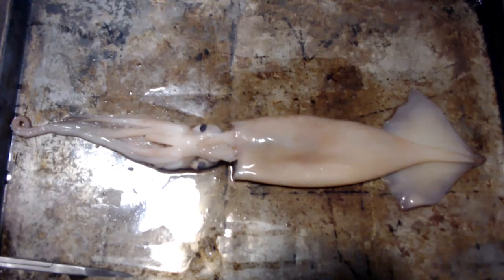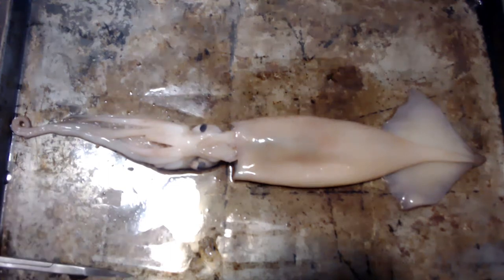I dissected a few during the week, looked at some of them to see if they were male or female. And this pack had at least like seven squid in it. I dissected the fourth one — that's when I was actually going to make the video. I did it outside, my dad held the camera for me, but it was so blurry. There was so much glare, and you couldn't see the organs or anything.